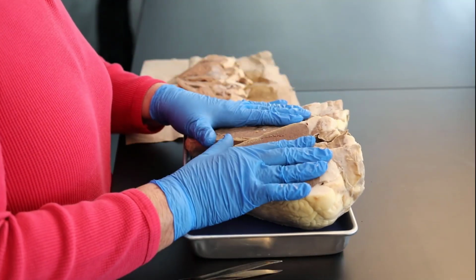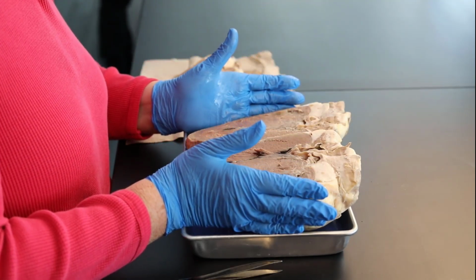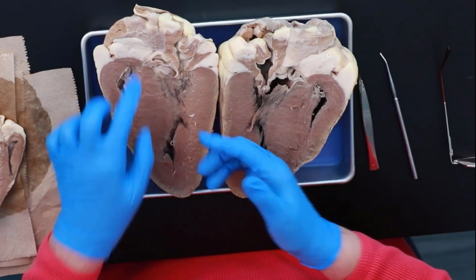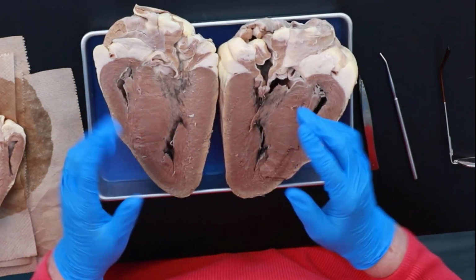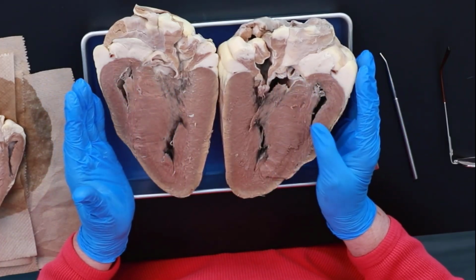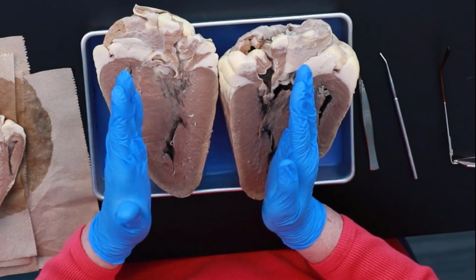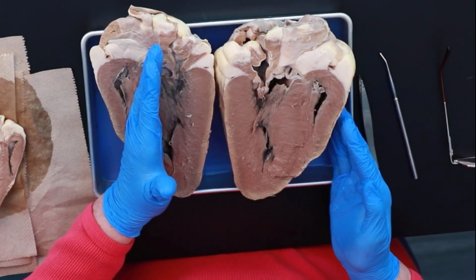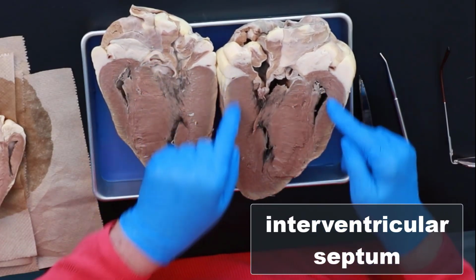But the first thing you have to do when you've got a practical and you're trying to figure out what is the name of this valve, or what is the name of this chamber, is decide which is the right and left side of the heart. And the way to do that is to run your hand right down what we call the interventricular septum. This divides the ventricles.